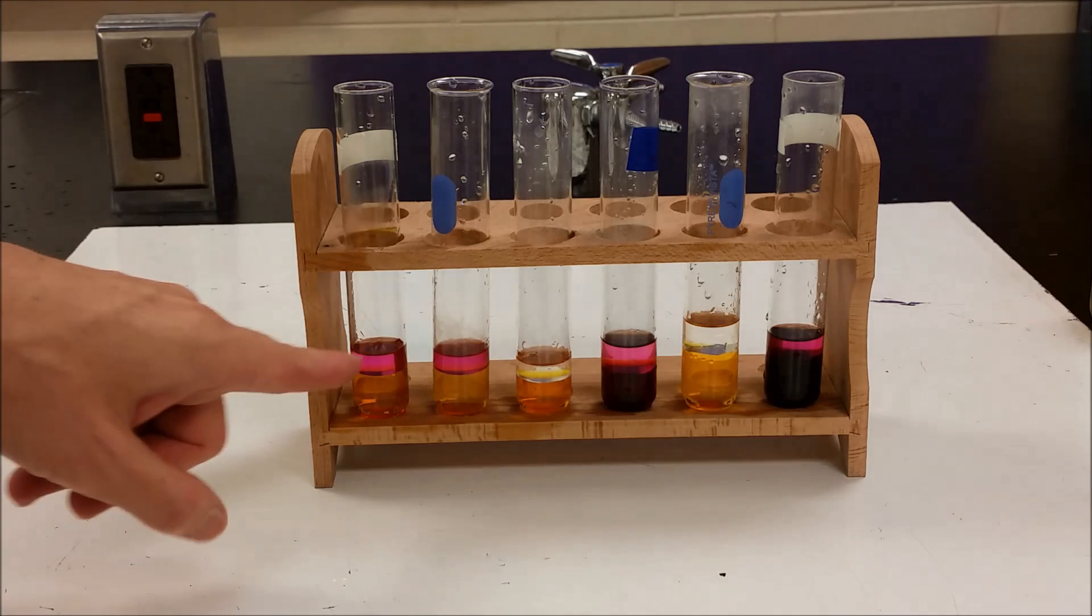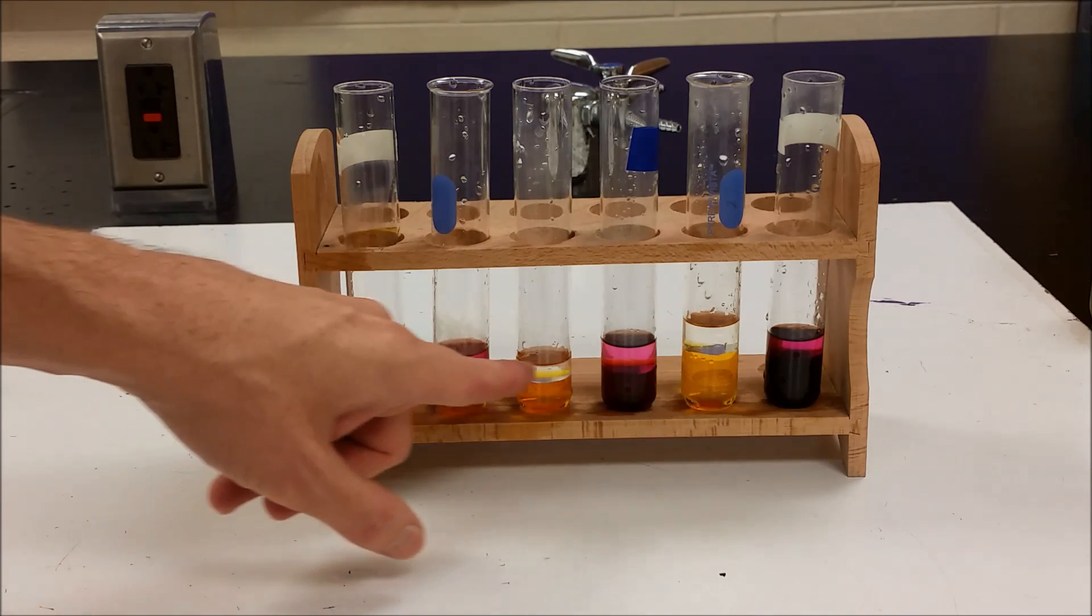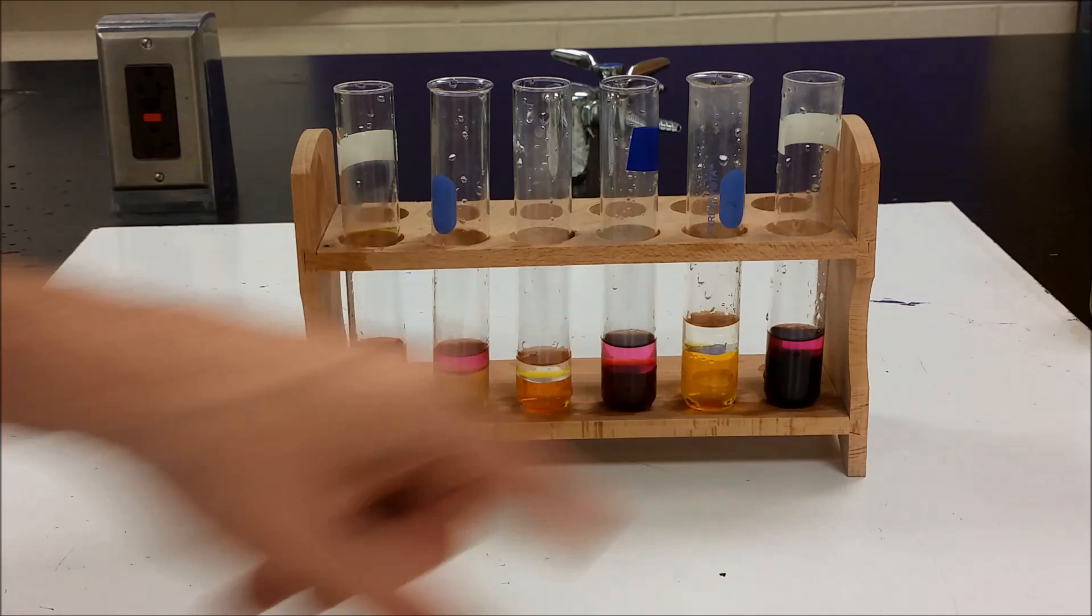So here we can see the finished product. We end up with iodine here, iodine here, bromine here, iodine, bromine, and iodine, which means that the chlorine is the most reactive of the three since we never end up with chlorine.